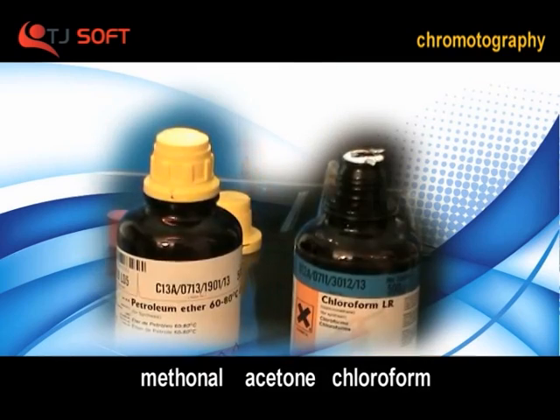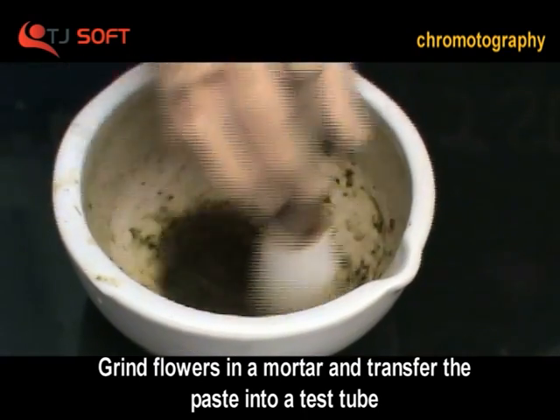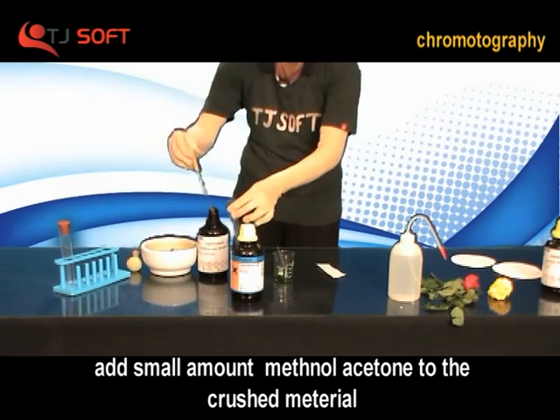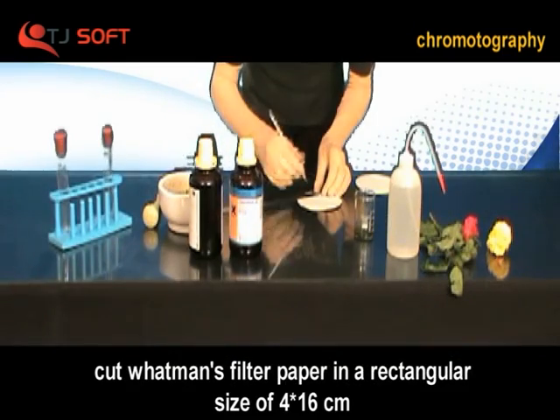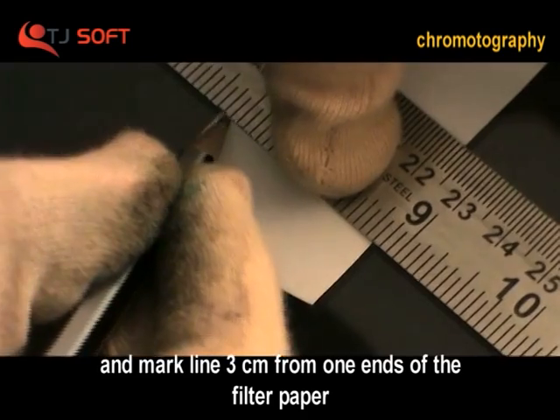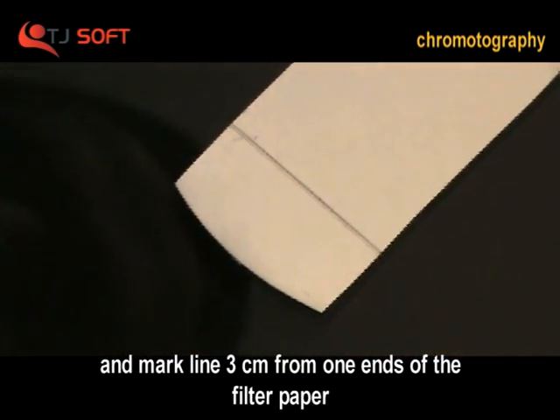Methanol, acetone, chloroform. Grind flowers or grind leaves in a mortar and transfer the paste into a test tube, then add methanol or acetone to the crushed material. Cut the Whatman filter paper in a rectangular size of 4 x 16 cm and mark a line 3 cm from one end of the filter paper.